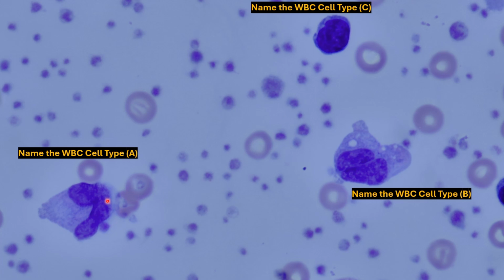The bottom 2 leukocytes are the same cell types. Overall, note that there's a single nucleus in both cases, and overall they have this U or horseshoe-shaped nucleus. The one on the right has a little bit of indentation right there. It's kind of hard to see. Overall, the size of these cells is a bit large, and they are kind of irregular, which is typical of monocytes.